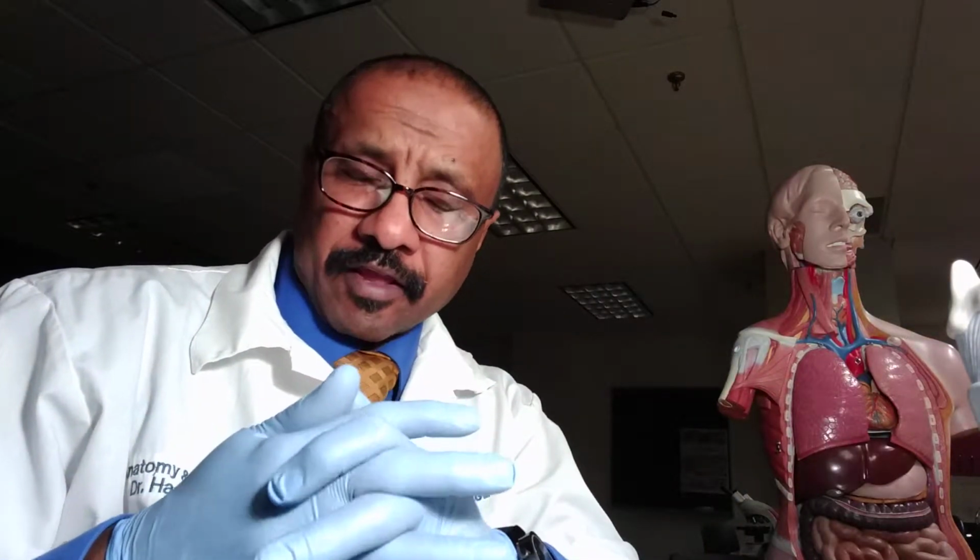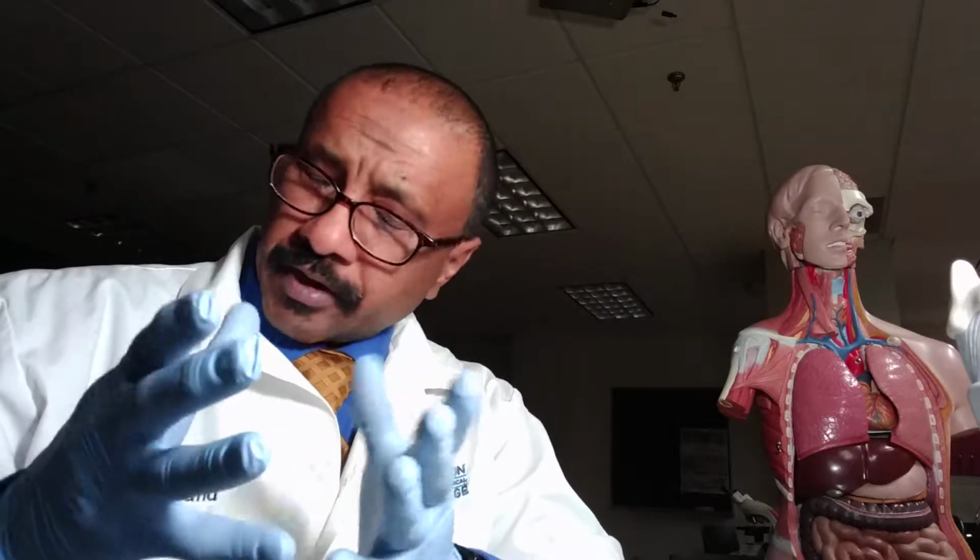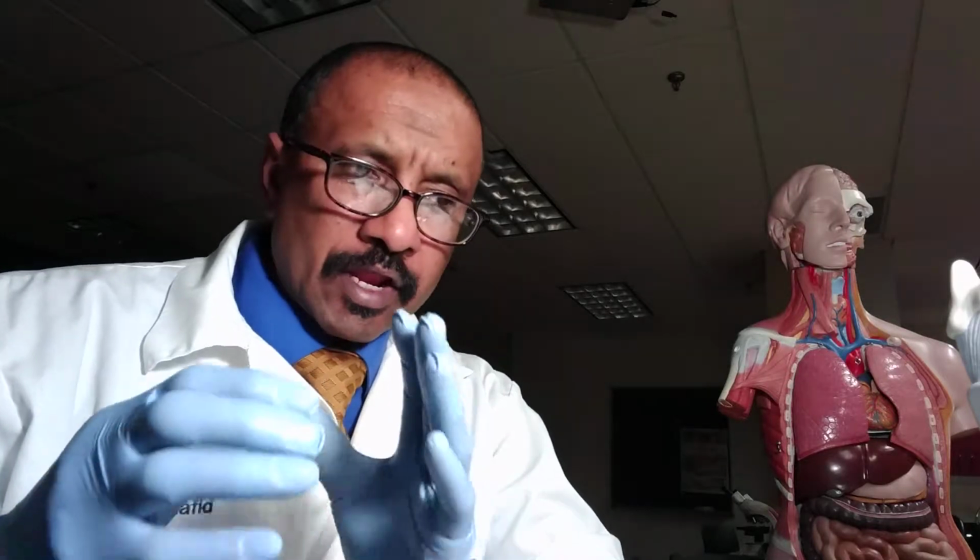The trachea is lined with mucus-secreting ciliated epithelium that helps to trap microbes, foreign bodies, and dust that might enter through the respiratory tract. It has walls that form and protect the lumen of the trachea. It has epithelium, submucosa, mucosa, and a cartilaginous layer structured from hyaline cartilage. We're going to take a look under the microscope at the details of the histology of the trachea.